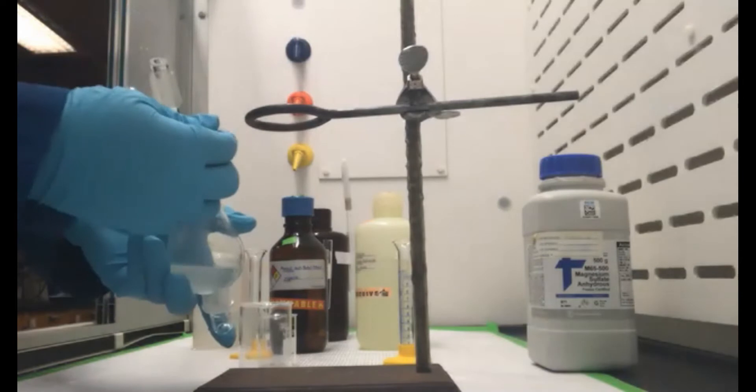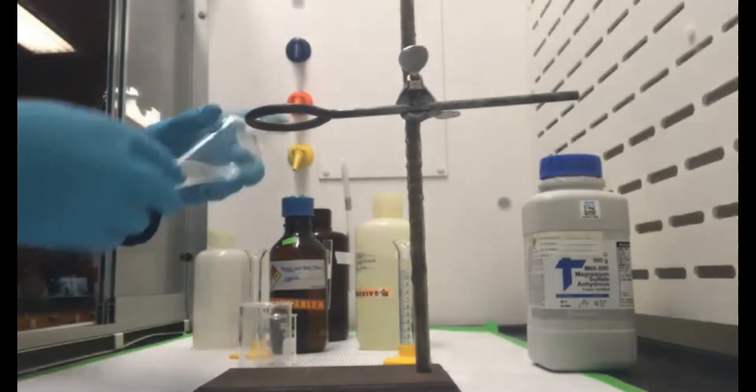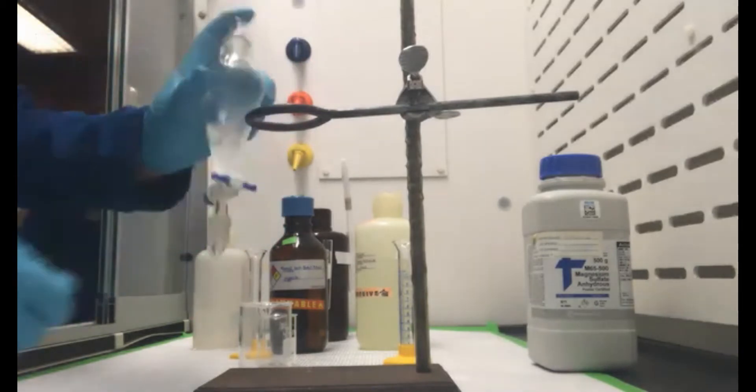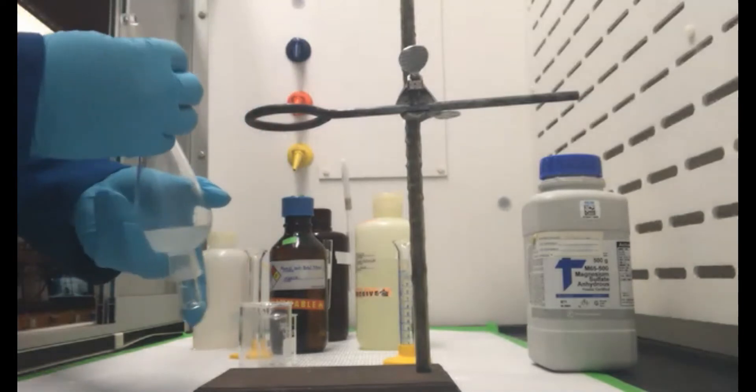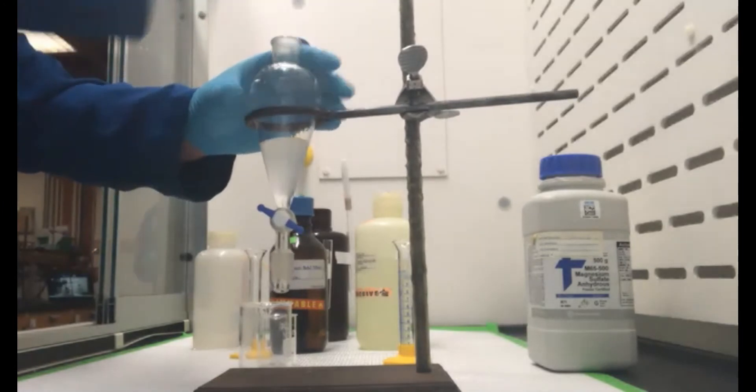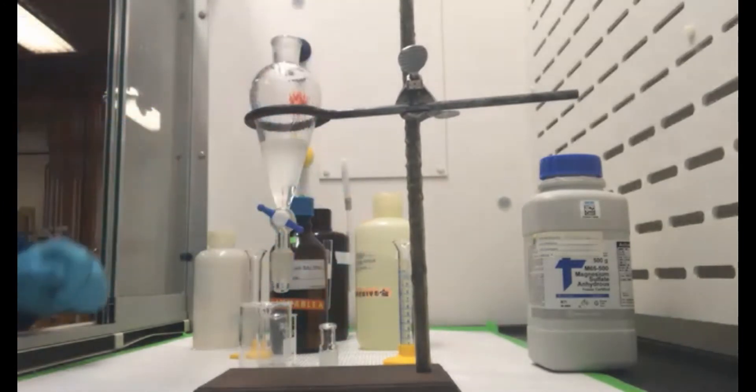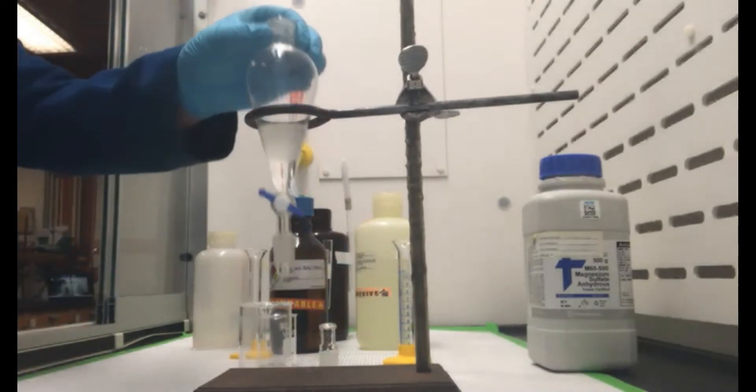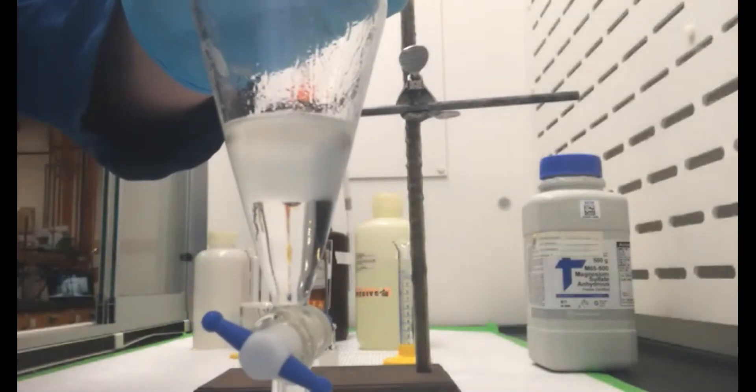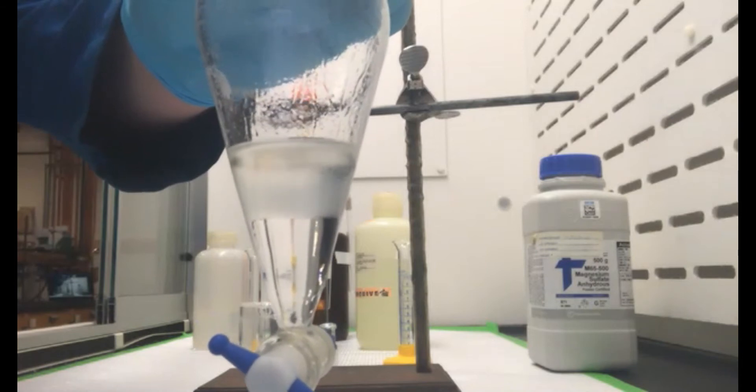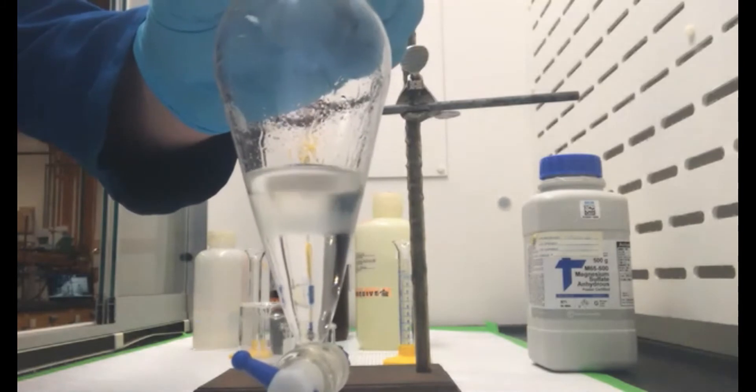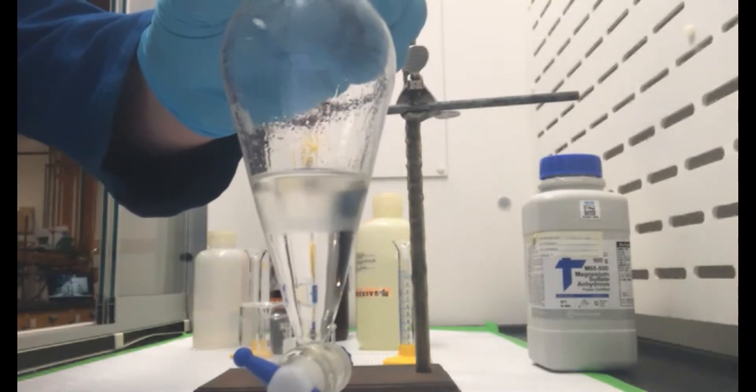Take that, invert it. There's an ether, so I like to vent right away on that first one. We're going to go ahead and let that separate. As you can see, it's starting to separate here. We're going to separate out. That should get nice and clear. We can see our aqueous layer on bottom and organic layer on top there.